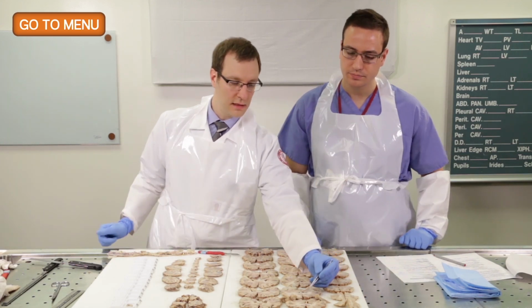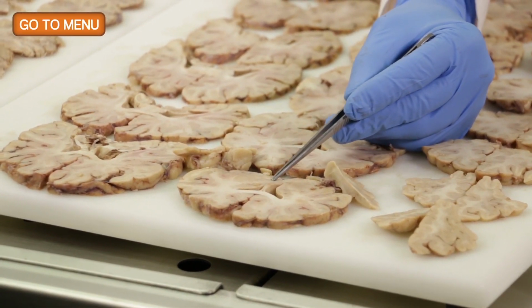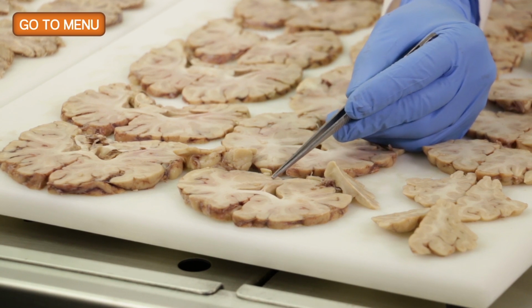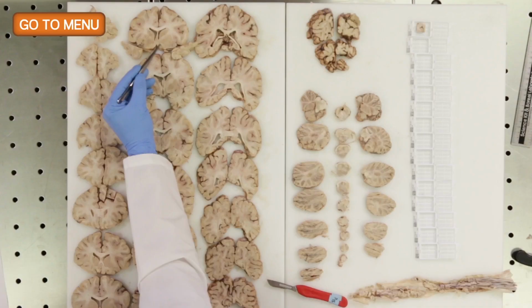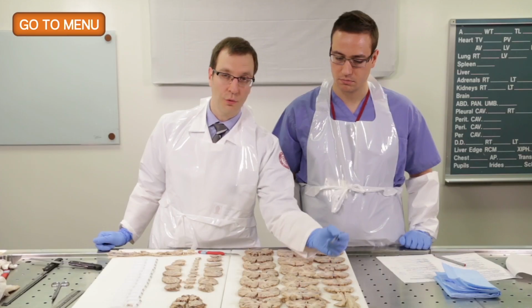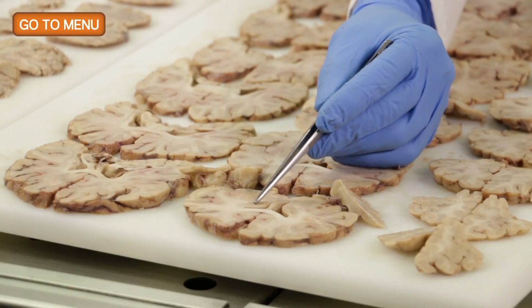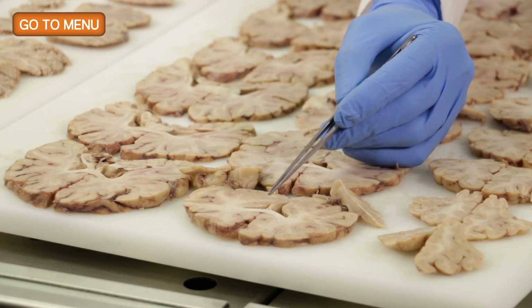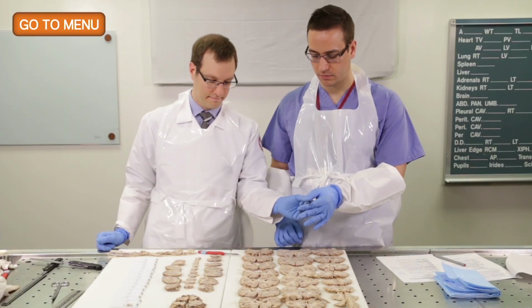So if we can see here, this white matter tract in this region, in the ventral aspect of the basal ganglia, is a white matter tract that crosses from one side to the other. This is the anterior commissure, and that is usually a good location to indicate where we have a nice portion of the nucleus basalis of Meynert, which is important for neurodegenerative disease. So if you can sample an area that includes part of the caudate, this internal capsule, the putamen, the globus pallidus, and the nucleus basalis all in one cassette, then that's ideal.